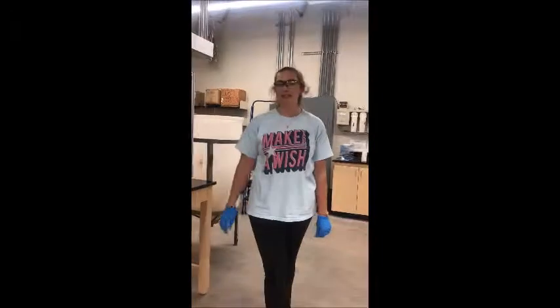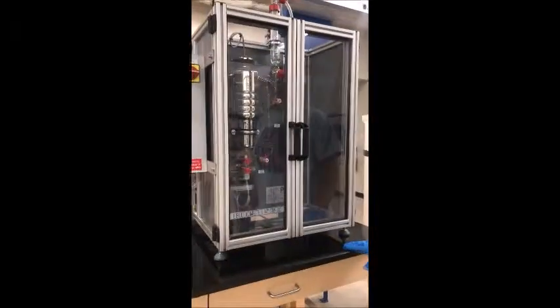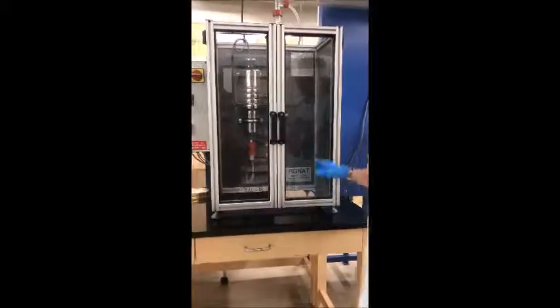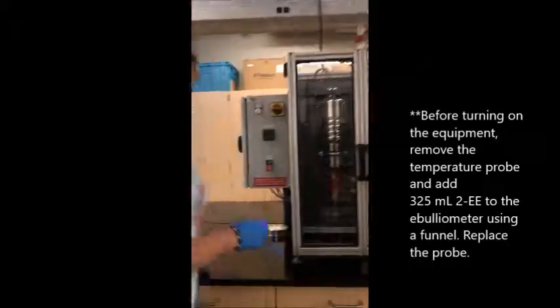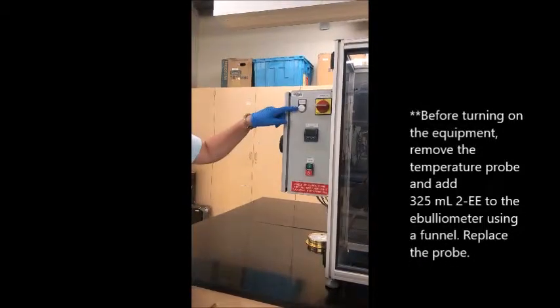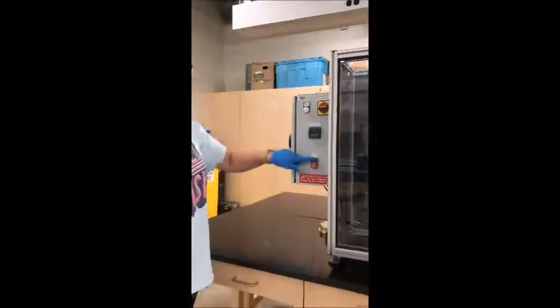Perform calculations for 10% decrease in concentration solutions of 2-ethoxyethanol. Once that is done, come over to the apparatus, ensure internal circuitry in the glass casing, and place beakers underneath the valves in case of leakage. Then turn the main switch on by rotating it clockwise, after which the white light will turn on, adjust the power level to 75% and click the green button.